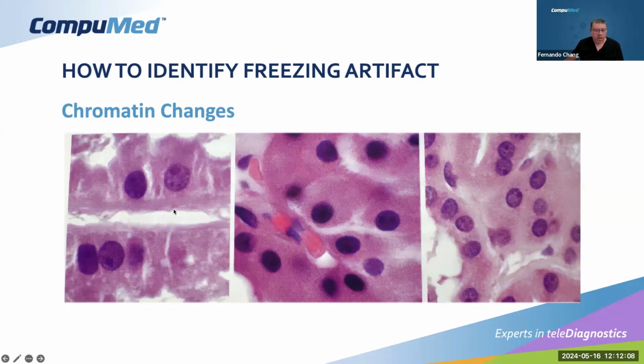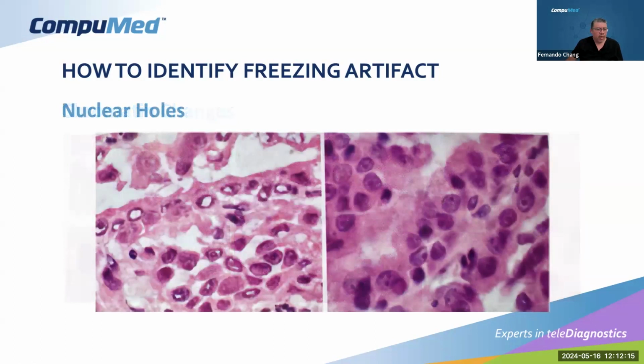And a little bit of this bubble of vacuolization as well on the left that we don't see on the right. And another type of freezing artifact also is nuclear holes. And we're going to see, in one of these slides that we have for practice, how the tissue architecture actually looks good and the pathologists were able to make a diagnosis.